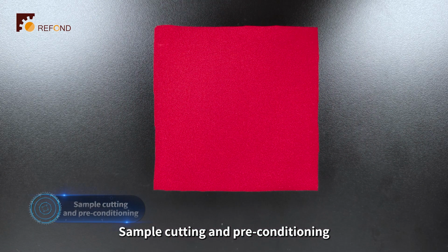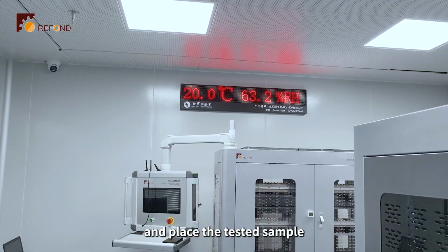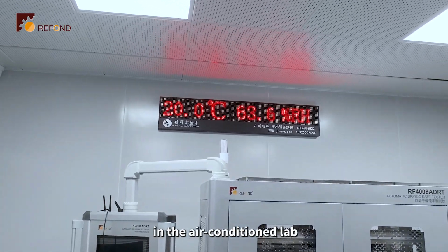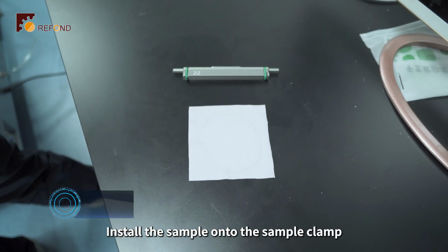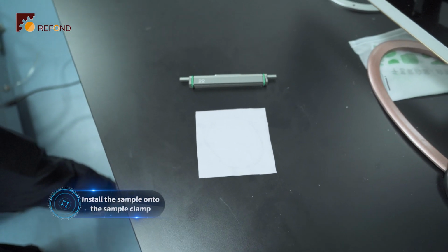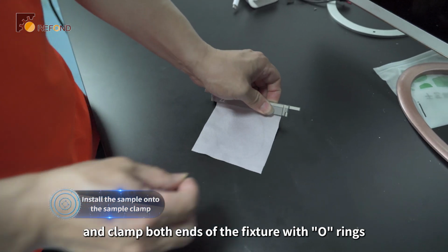Sample cutting and preconditioning. Cut the sample into a 100 x 100 mm square and place the tested sample in the air-conditioned lab for at least 4 hours for preconditioning. Install the sample onto the sample clamp. Place the sample into the sample holder and clamp both ends of the fixture with O-rings.